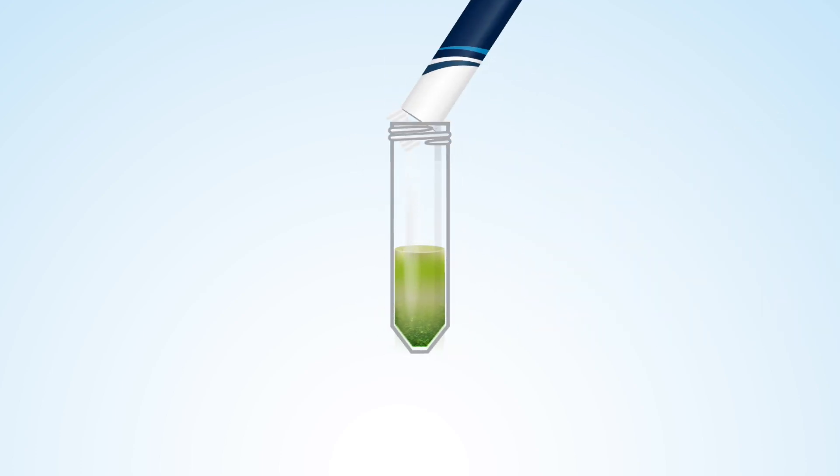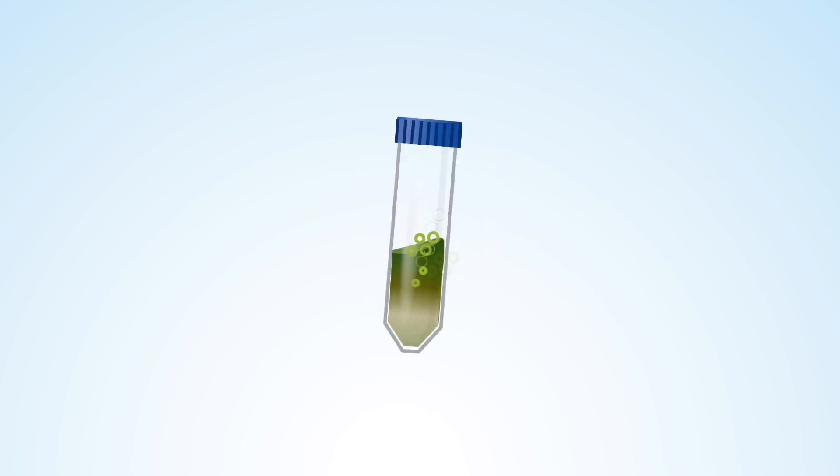Next, add the extraction salts, shake the tube vigorously again, and now it's ready to be centrifuged.